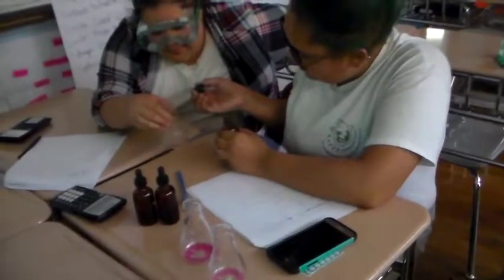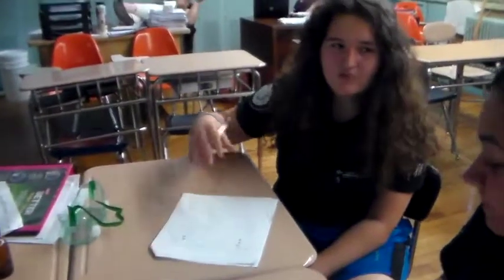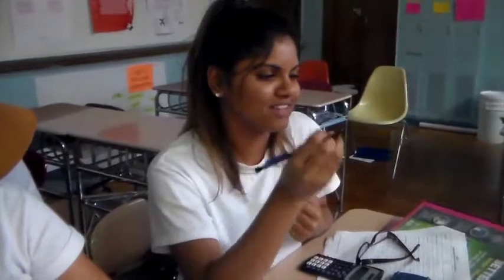So what data analysis method did you choose first? We chose to find the average, because there are 3 different ones, and we cannot do it for each one of them. It's better if we take the average of all of them. That's what I think. What do you think? That is a good idea. I agree with her. We take the average of all 3 of them.